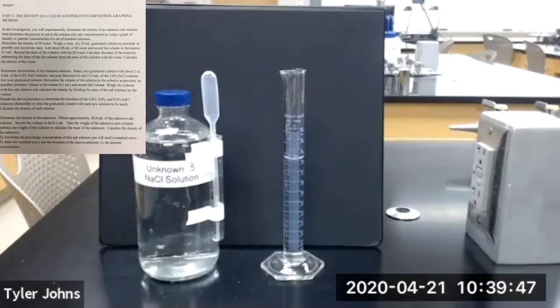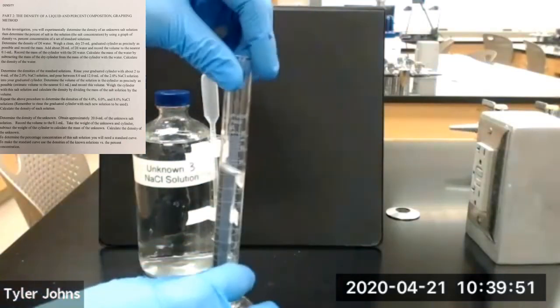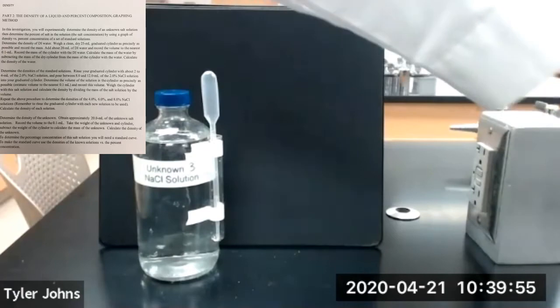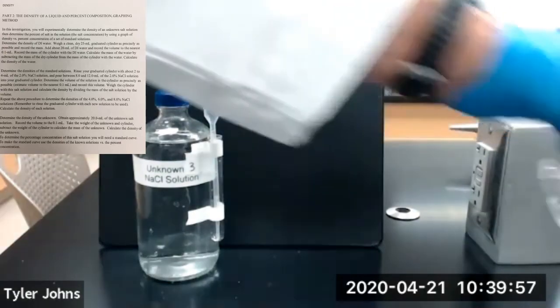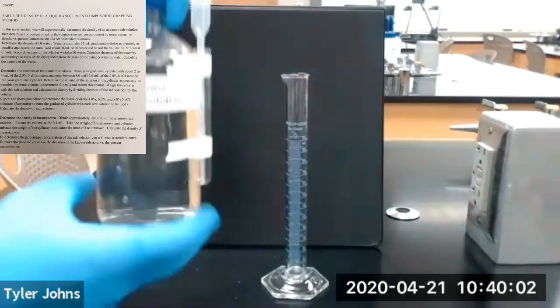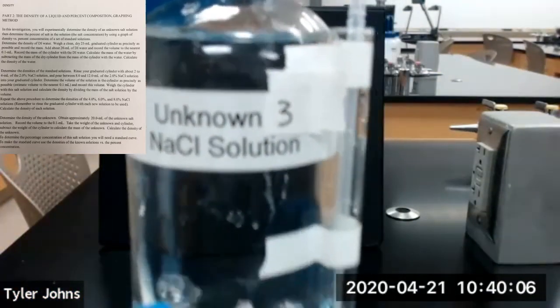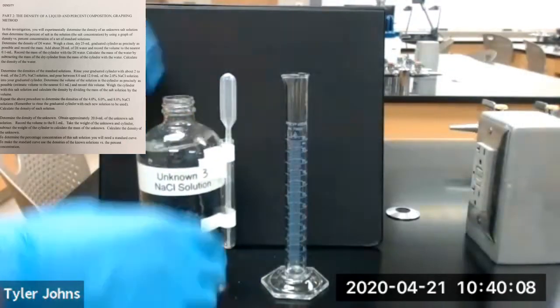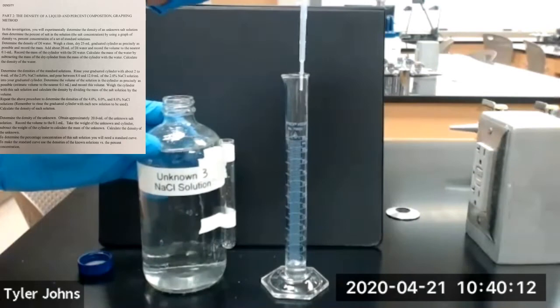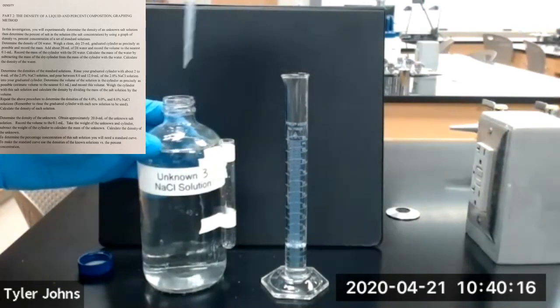Okay, so we're going to move on to our final unknown salt solution. We're going to dump the remaining unknown salt solution number 2. And we're going to be using unknown salt solution number 3. So we'll rinse our graduated cylinder with several milliliters of unknown salt solution number 3.